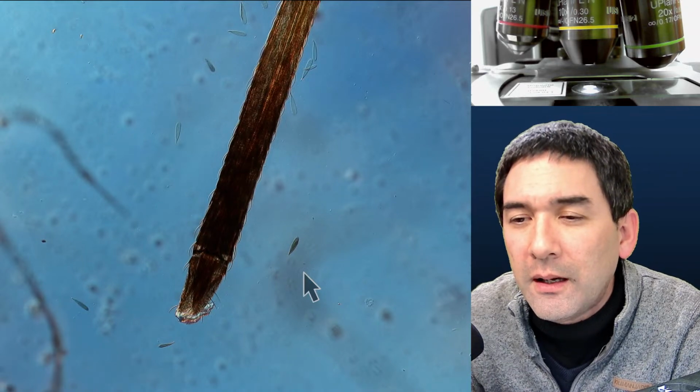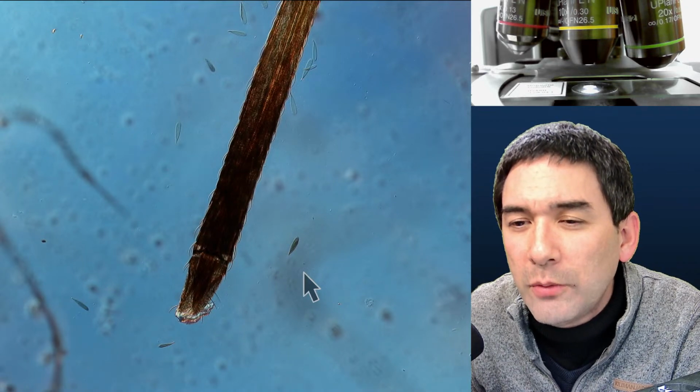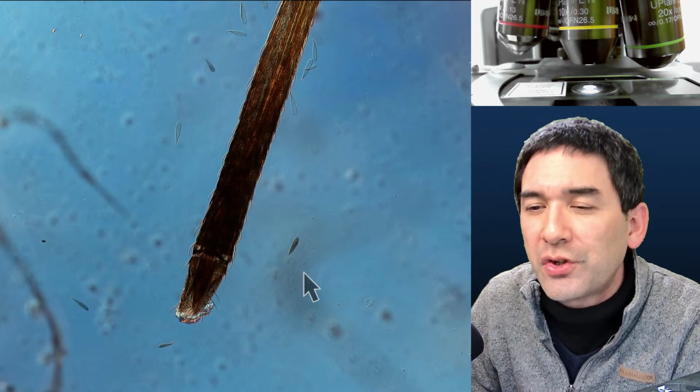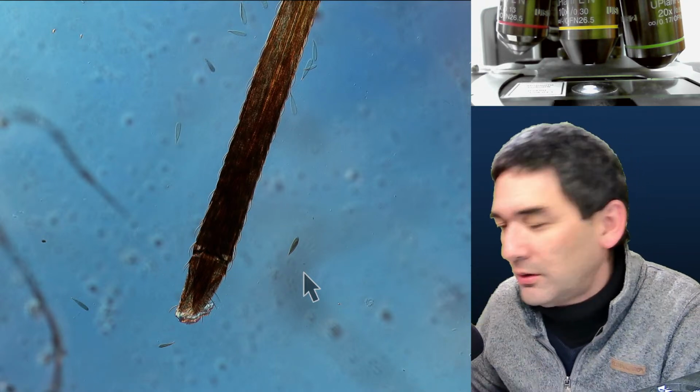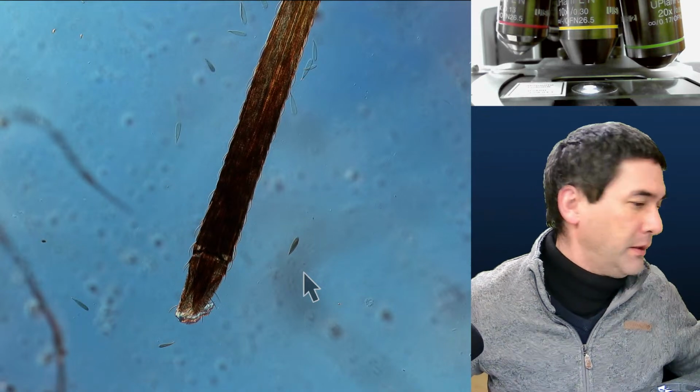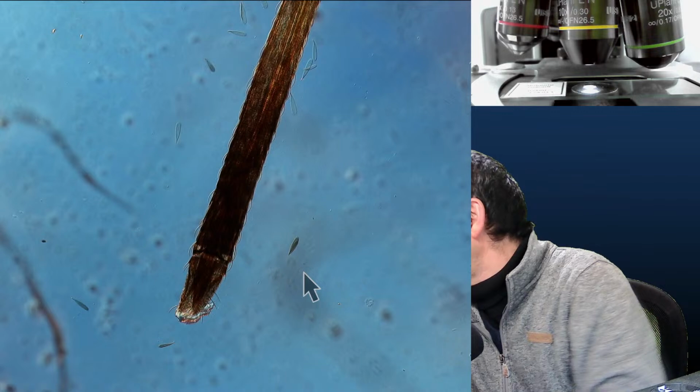From the previous videos, what is the volume of the auto pipette that you use? Is 2.5 microliters enough for protozoa? I think that's too small. 2.5 microliters. Just a second. Where is the pipette? Where did I put it? Just a second. Here it is.